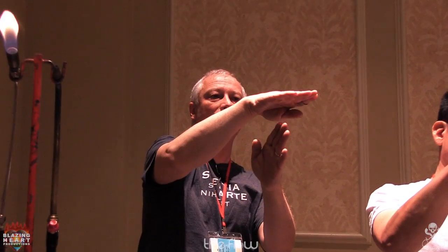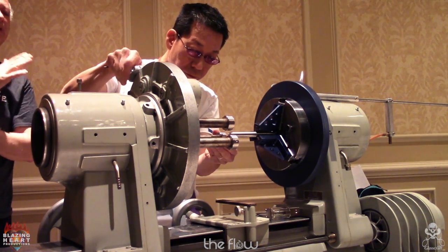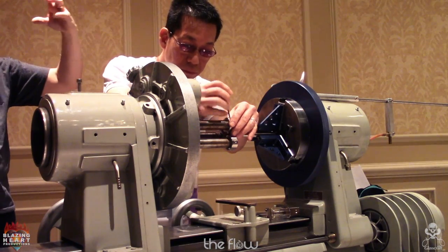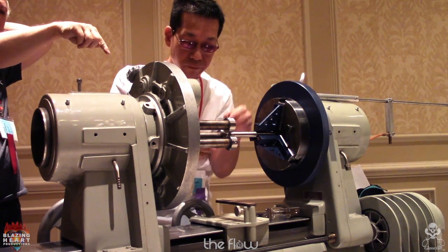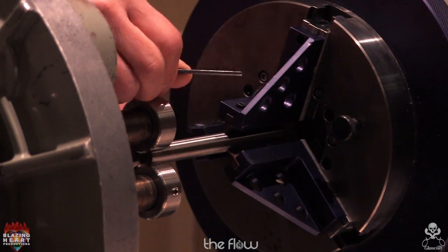He's got a little shoulder in there. And what he's going to do now is get all the donuts set exactly to the same distance so that when you chuck that flange on there, the flange will slip up against the back end of the shoulder and the flange will sit straight. So the stainless rod now is just an indexing rod to get the donuts positioned in the right spot.